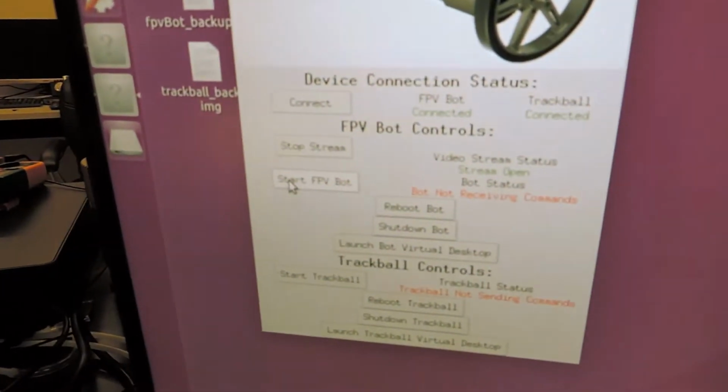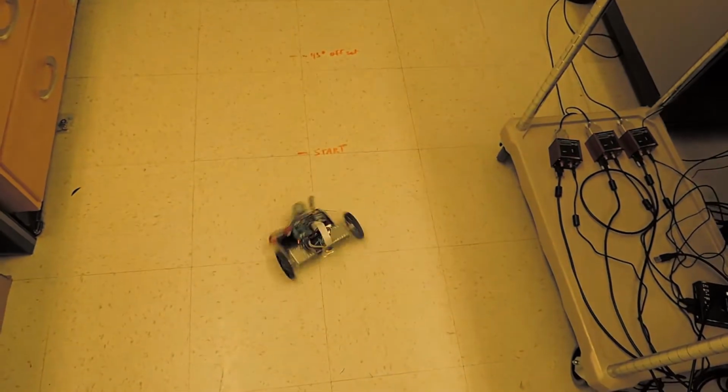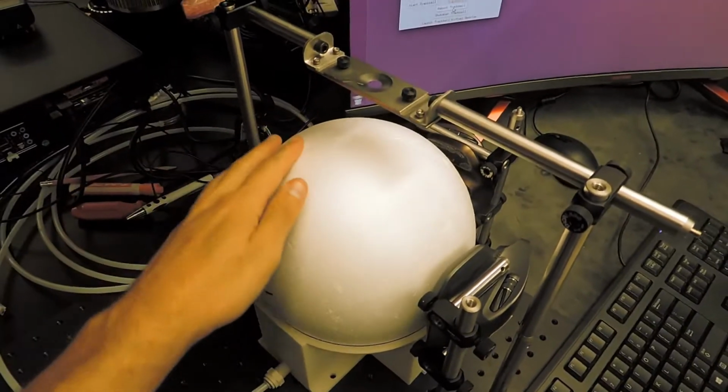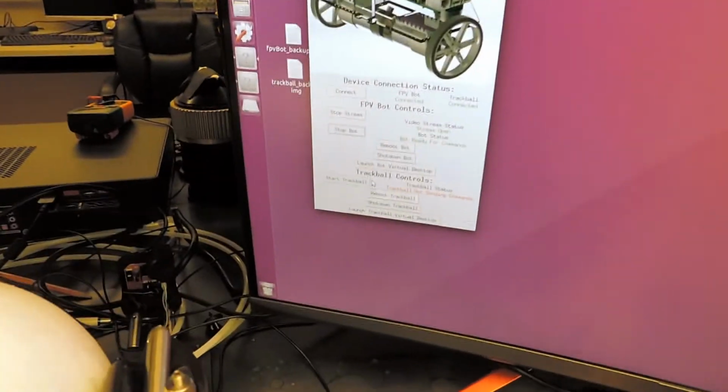We can start the robot so it's ready to receive motion commands, and that does a little dance when it's on. Turn on the air for the trackball, and now it's free to move. And let's start transmitting coordinates.